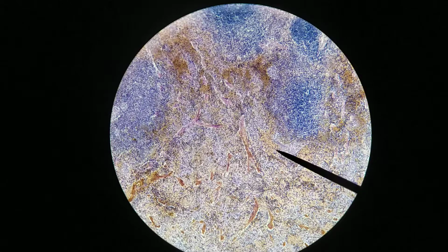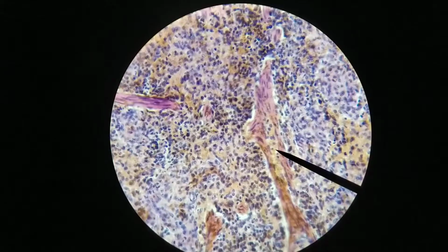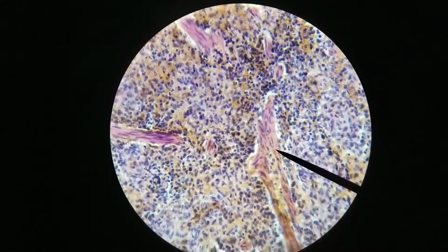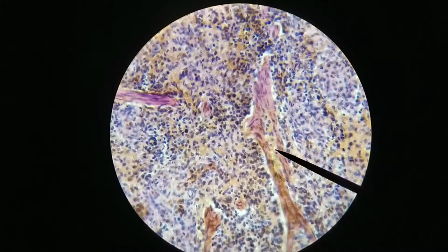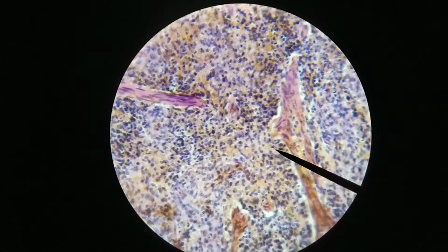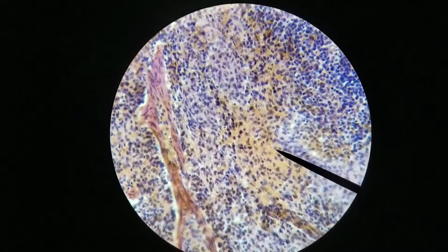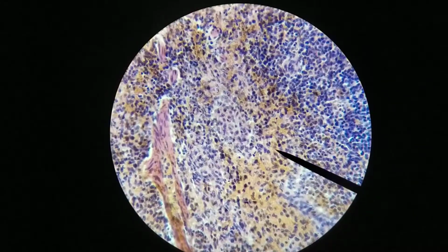So let's kind of zoom in on that, go to 400x. And so here we see, still within a trabecula, we have a blood vessel. We're seeing a longitudinal section through this blood vessel here, inside of a trabecula. Okay, the fact that it's surrounded mostly by red pulp tells me it's probably a vein or venule collecting all of this. And again, this is the red pulp itself.